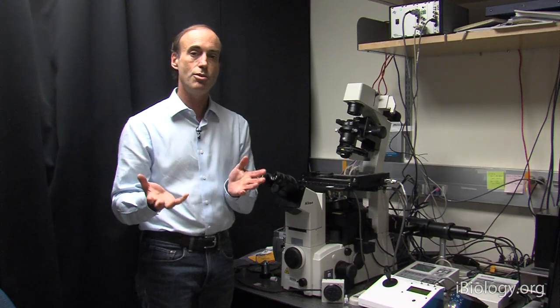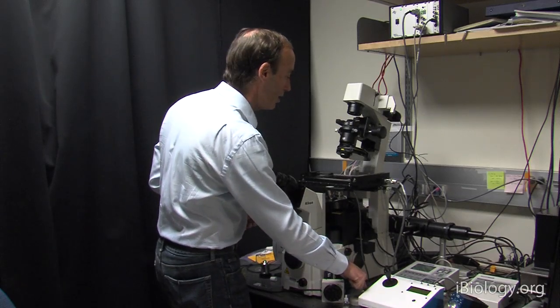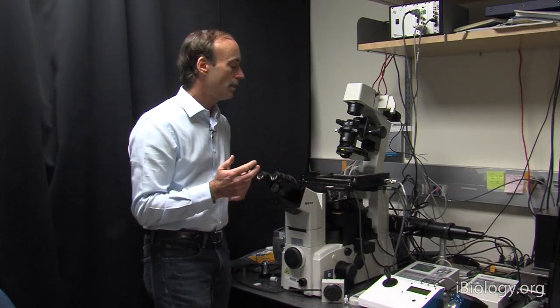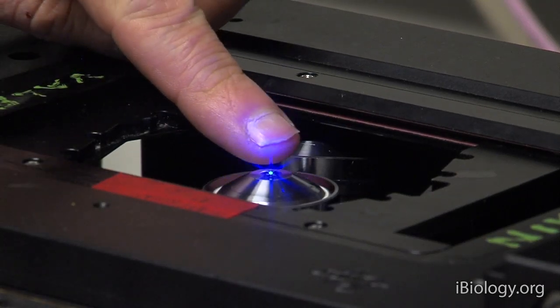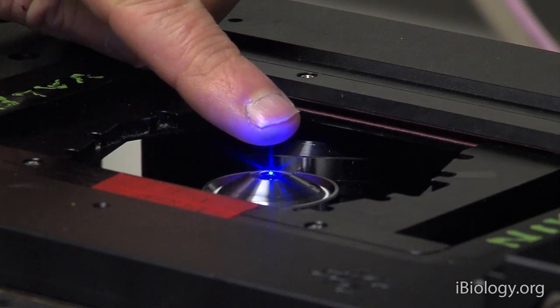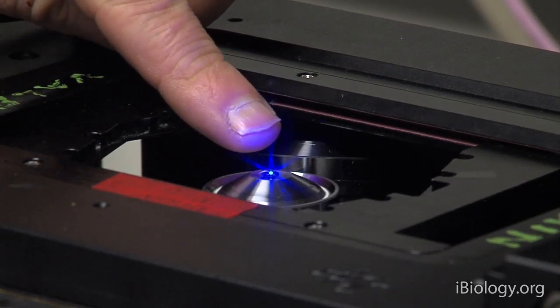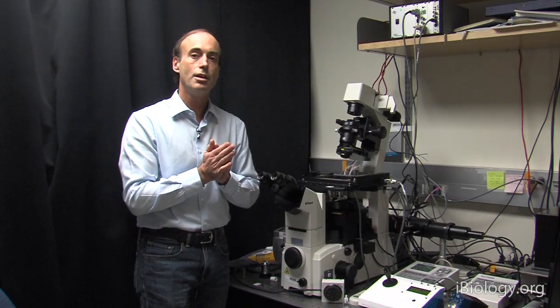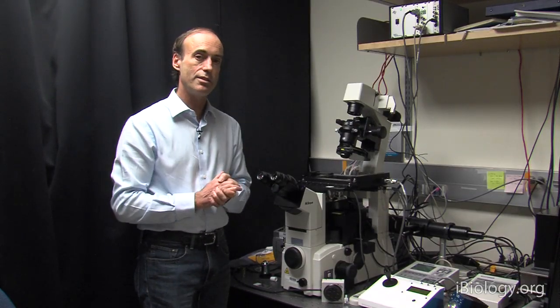In this case, I'm using a green fluorescent protein, and when I open up the shutter, I can see that there's this bluish-green light, which is the correct excitation for GFP. I know also in advance that I have the correct emission and excitation filters in here, so I should be able to excite and view the fluorescence of the GFP.